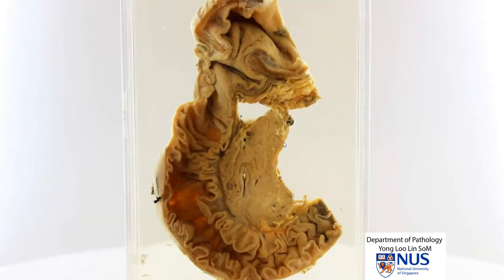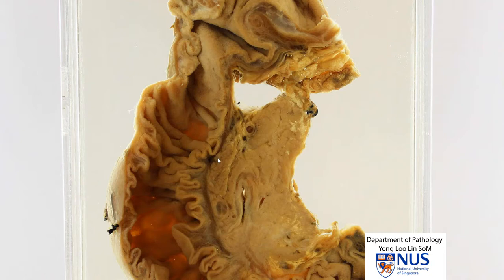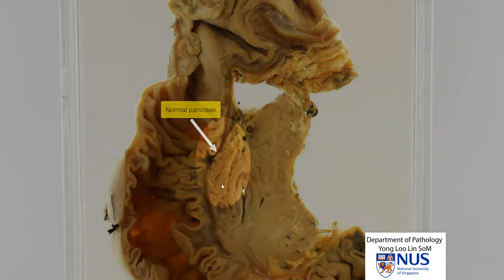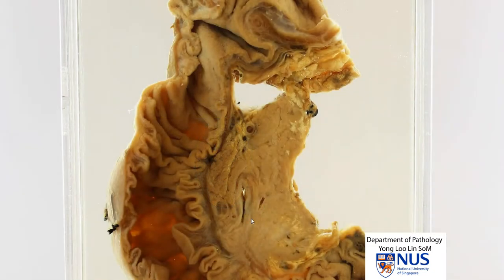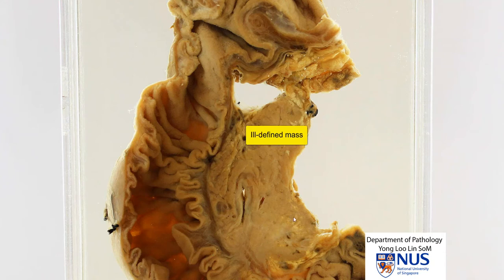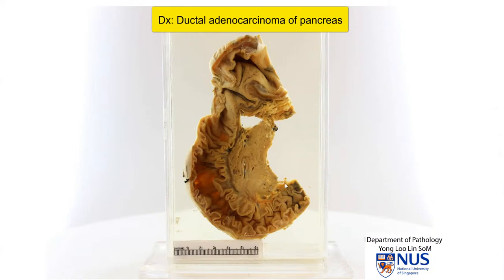So the pathology lies in the head of the pancreas. First, let's take a look at what the normal pancreatic parenchyma should look like. This here is an example of what's left of the normal pancreatic parenchyma. It usually has a somewhat lobulated appearance, very similar to salivary gland. And what we see instead is actually a very ill-defined pale tumor mass that I can't really even delineate very well. So this is an infiltrative tumor mass in the head of the pancreas, and this is an example of ductal adenocarcinoma of the pancreas.